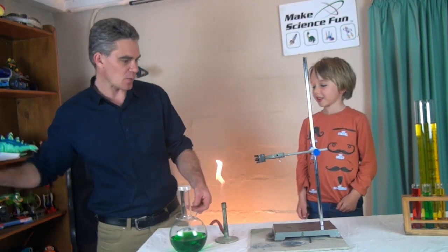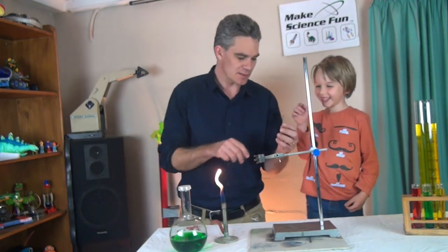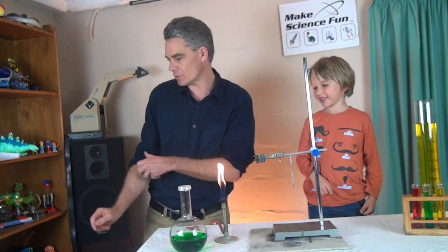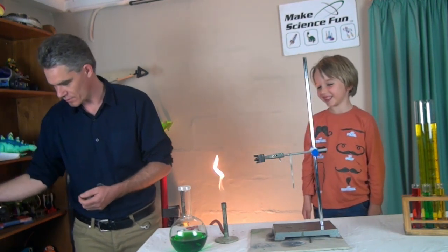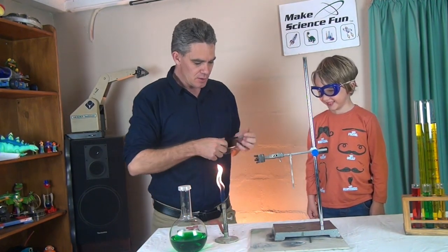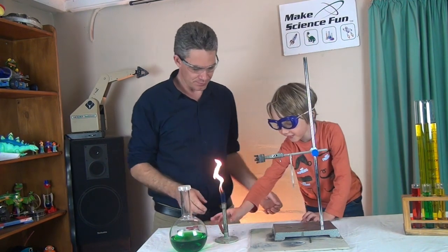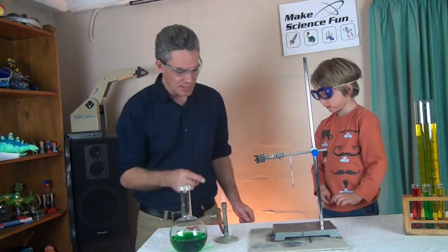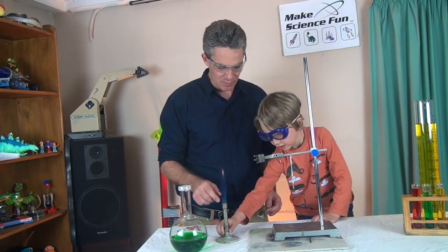And look, I can even cut this one with some scissors. See, I can snip it with some scissors. And I'm going to put it on the retort stand. And Sam, we're going to put on our goggles. Something will happen. Okay, all right, Sam, do you want to put the Bunsen onto the jet flame noise? That's it. And Sam, do you want to pick up the Bunsen burner and hold it so that the flame is touching the bottom of the metal?